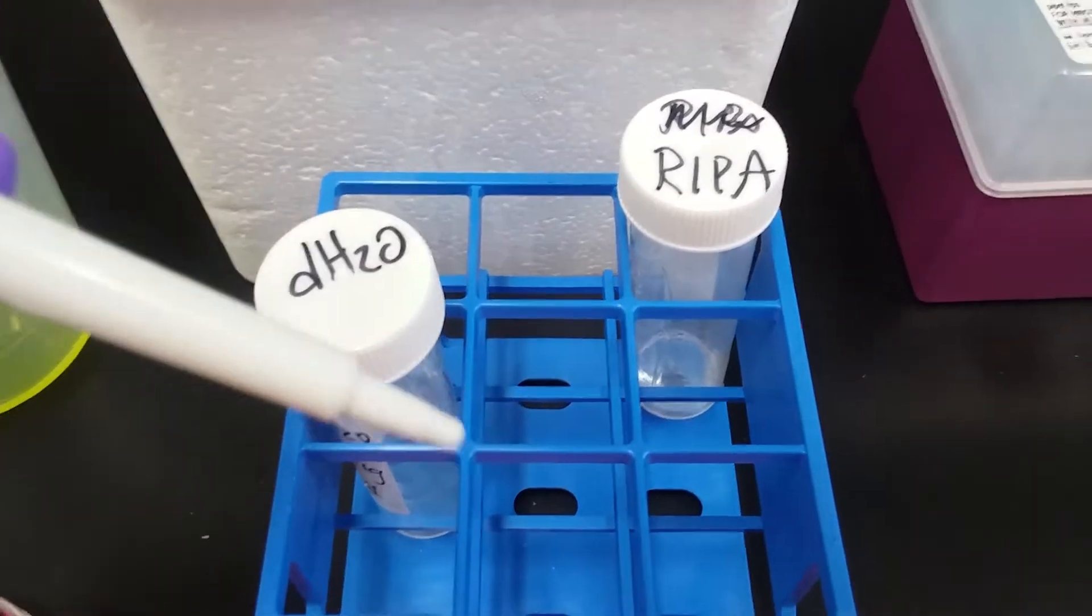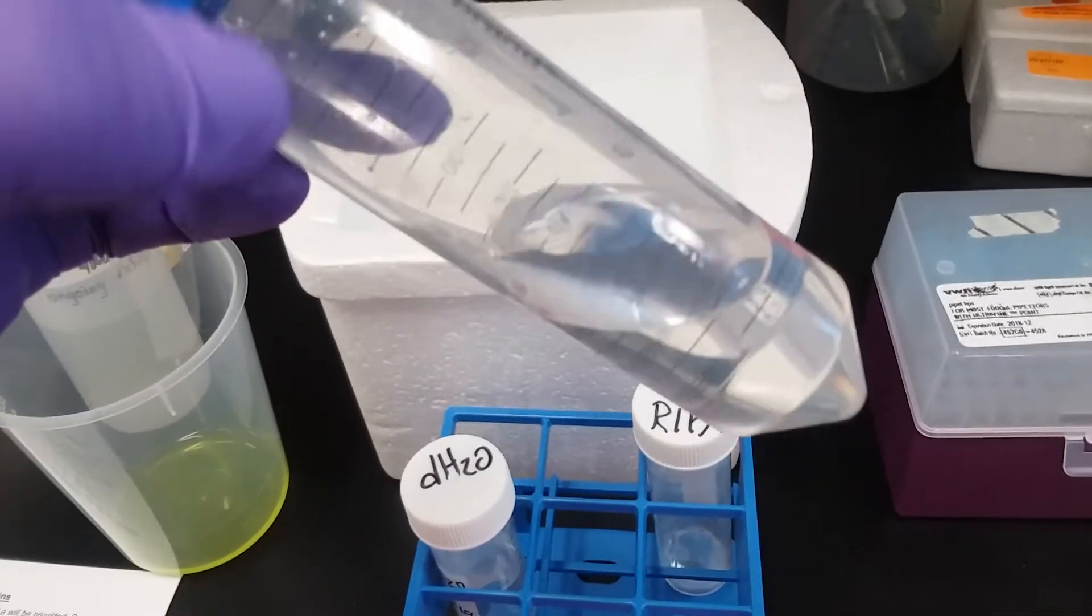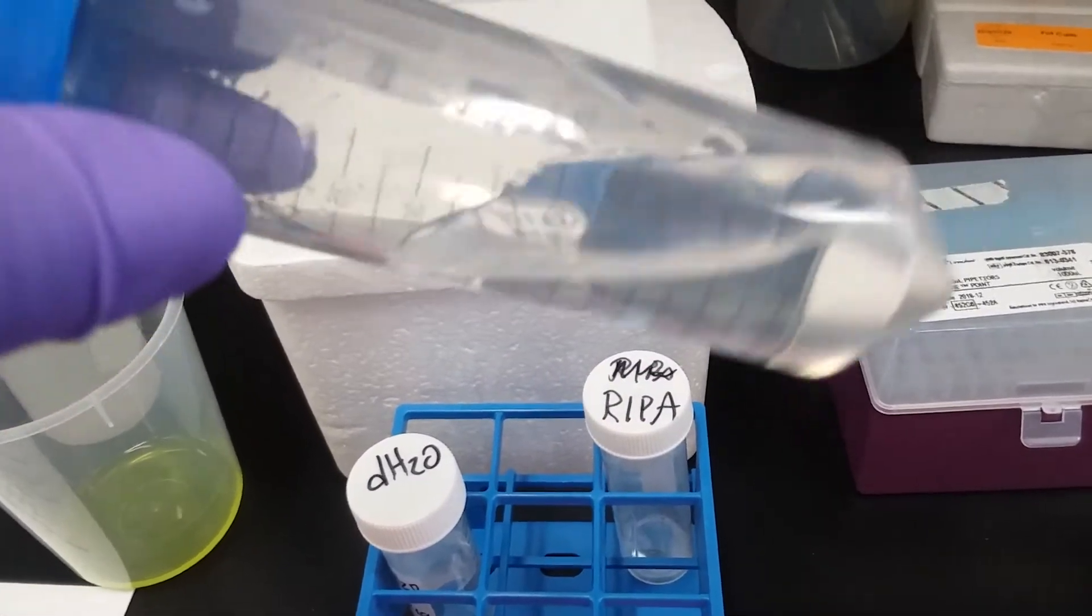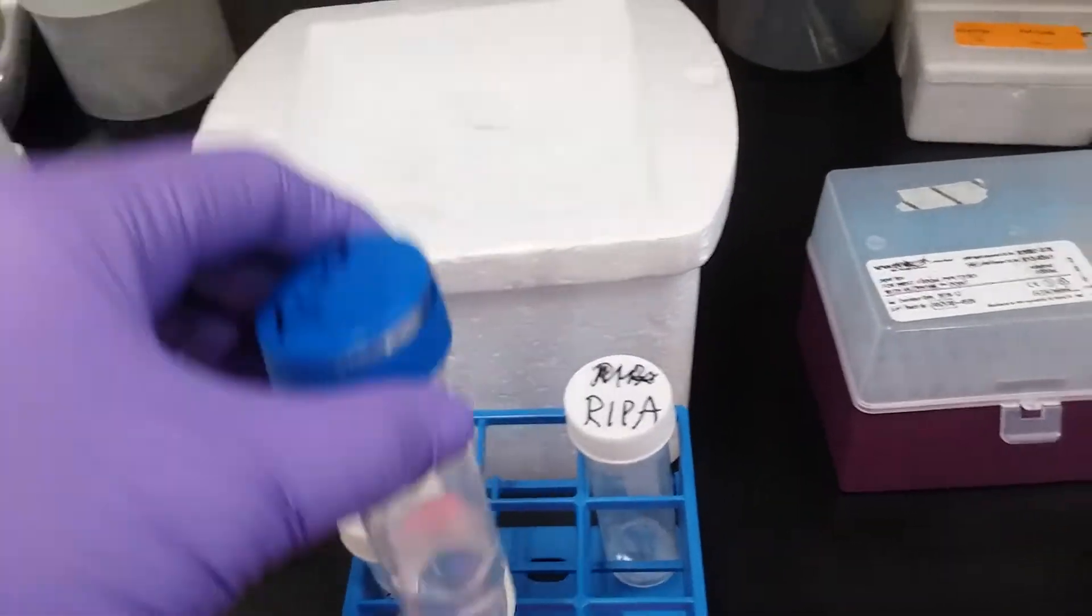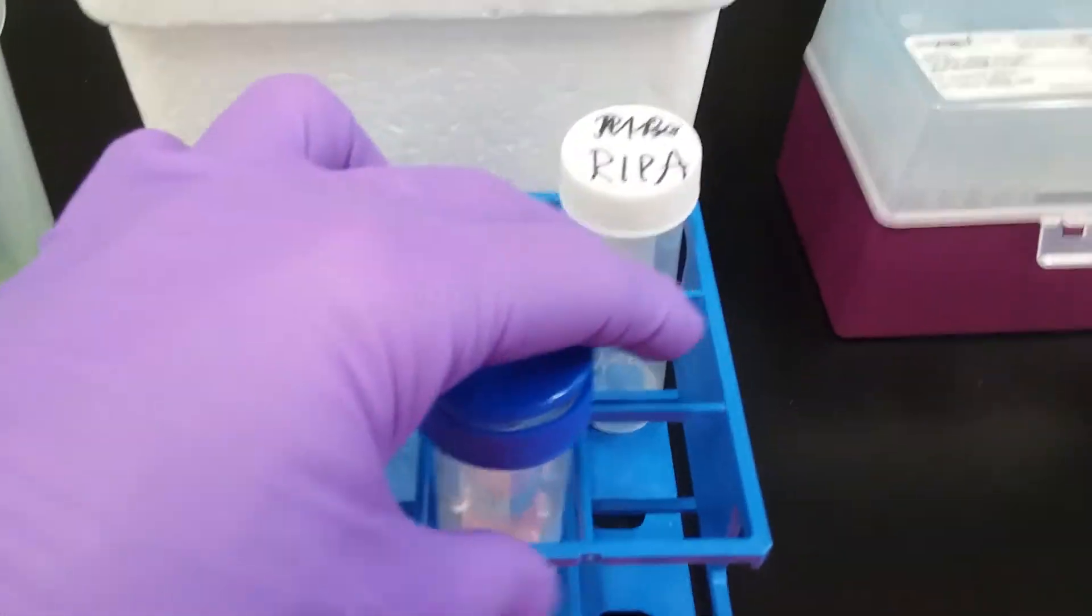I'm going to take a minute to talk to you about Triton. This is our Triton X-100. It's a solution that is very viscous, so a little trick in the lab is that when you're about to pipette your Triton, instead of just using this small bore on the yellow tip, you can just take a certain portion of that tip and cut it off with a pair of scissors, and you end up increasing the bore size so that you can liquid transfer something that's pretty viscous.